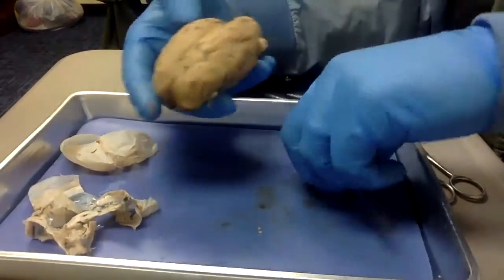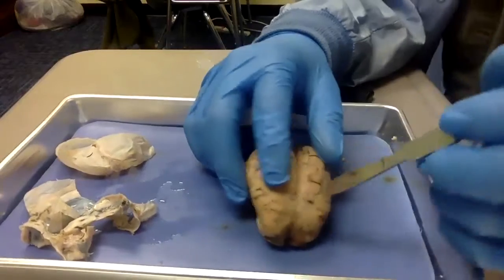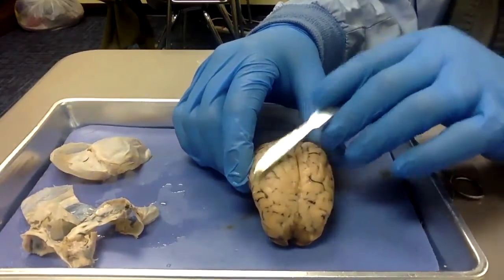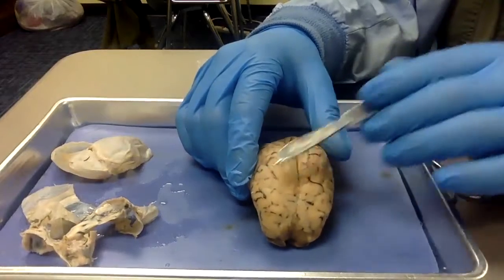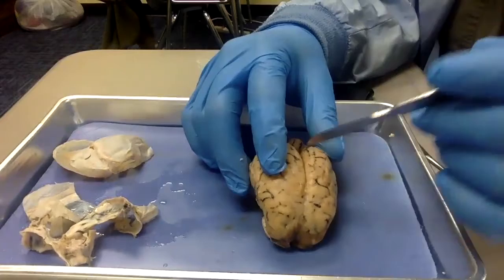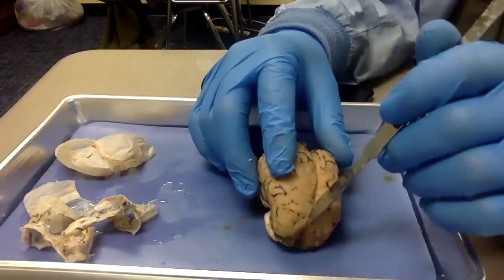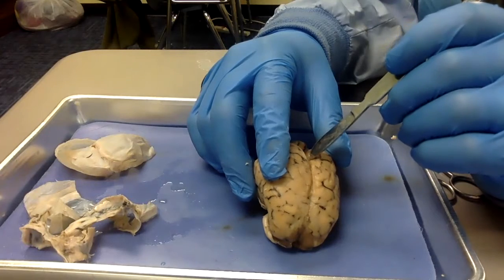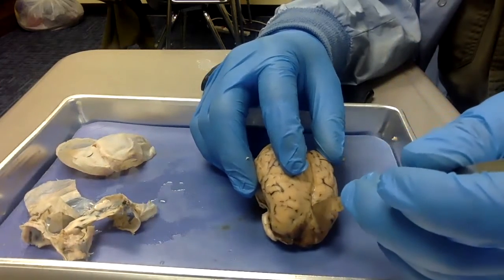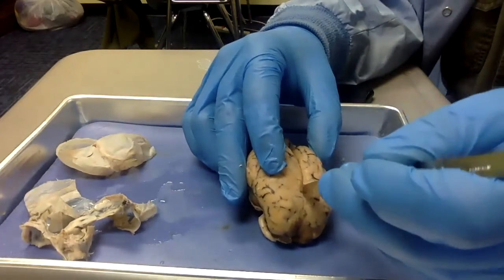So let's make a cut. First thing I'm going to do is cut very gently. I'm not going very deep. Remember, you got two hemispheres. You have the left hemisphere and the right hemisphere. And again, they are two separate brains in and of themselves, really, but they're attached. They're attached by something called the corpus callosum, a bundle of nerves right in the middle. Right in this middle area, this crack called the longitudinal fissure, there is a bundle of nerves going back and forth. So I want to try to cut that, this pia mater.